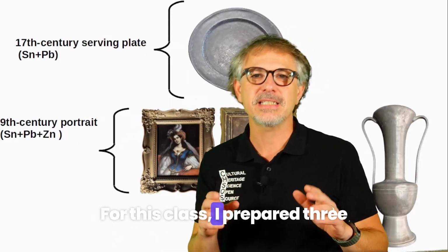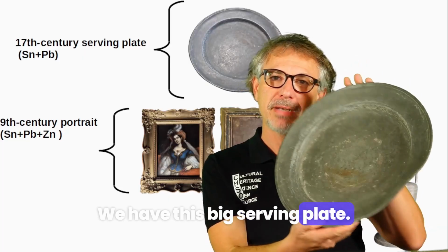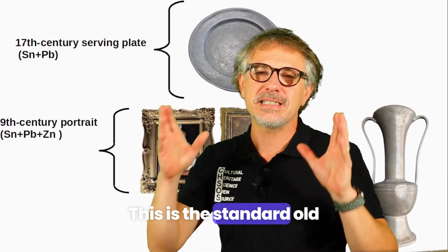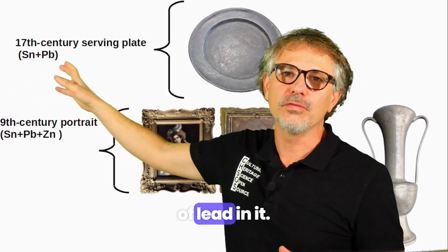For this class I prepared 3 objects made of pewter. We have this big serving plate, which should be around the 17th century. This is the standard old medieval pewter. So we have tin and we have a lot of lead in it.